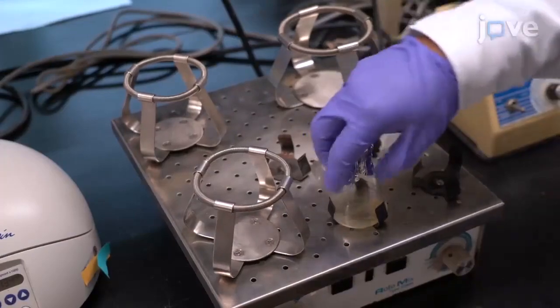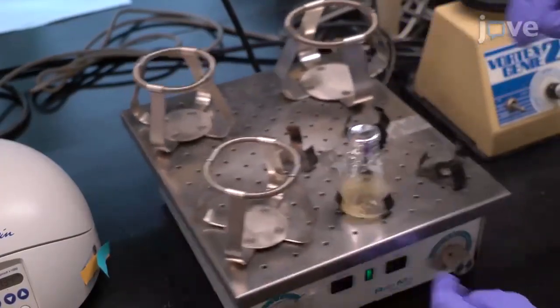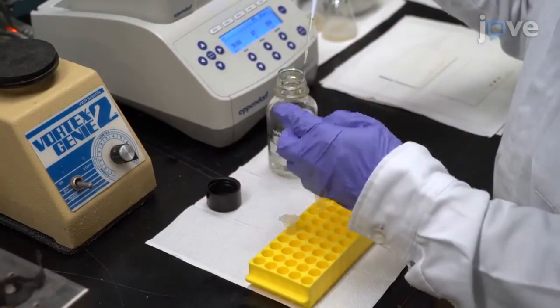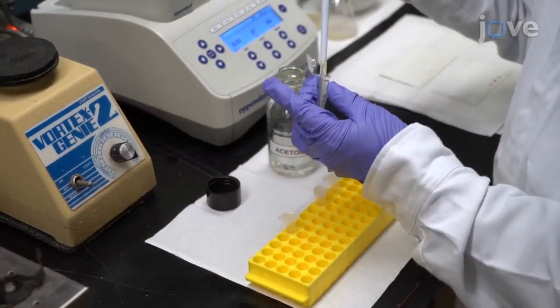Then, mix the sample at 100 RPM with a rotator for 5 hours at room temperature. After this, resuspend the sample with 25 microliters of acetone.